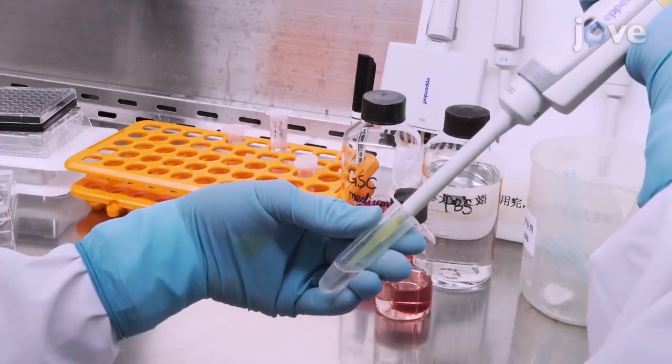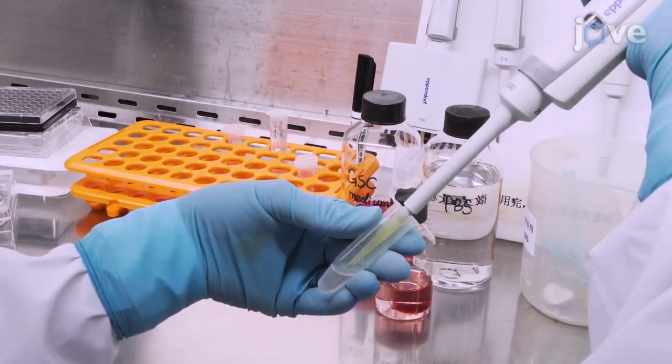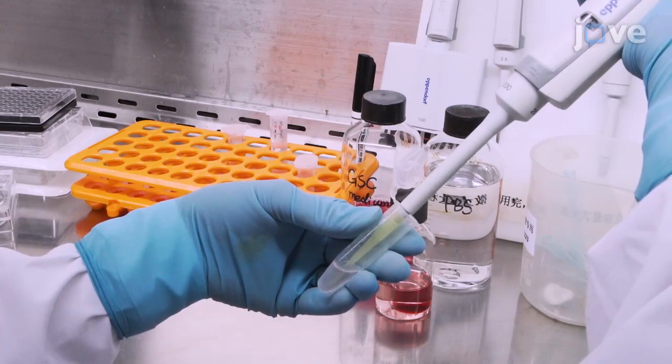Using a 200 µL tip, pipette the cells repeatedly to dissociate and re-suspend the cell pellet.